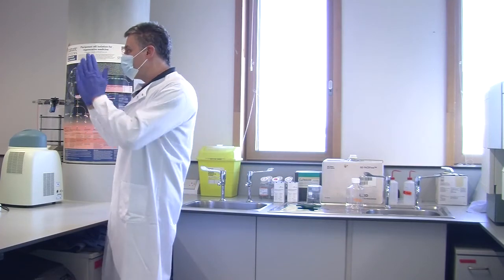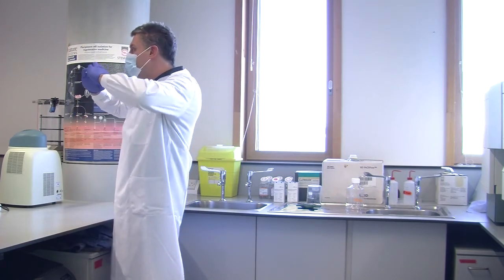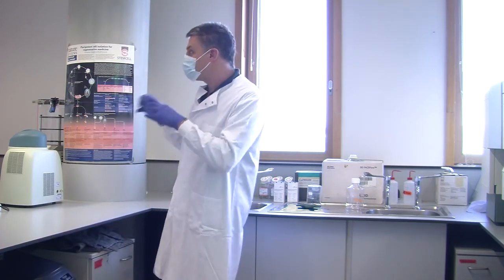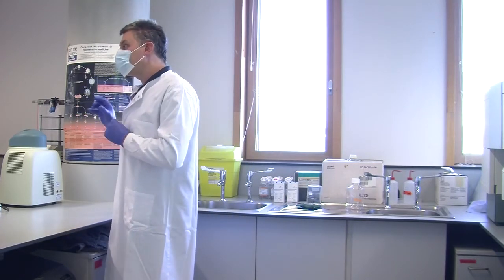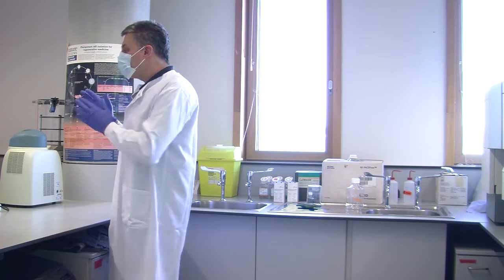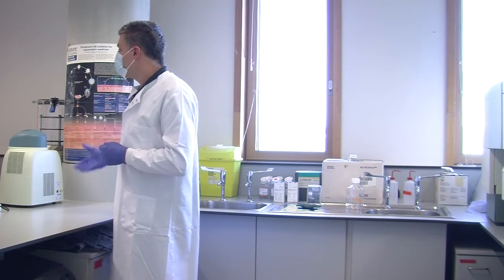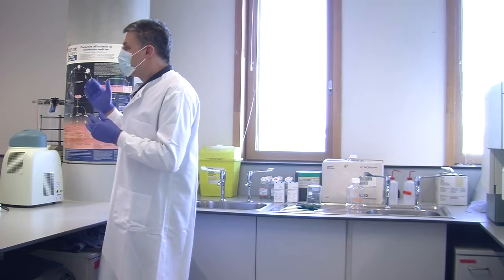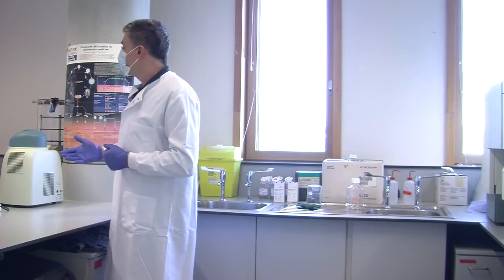But some fluorochromes have an emission spectra that's sort of that shape, which doesn't really affect others. Others have an emission spectra that's like that, which causes lots of other problems. So there's all sorts of different reasons to choose a particular fluorochrome. And when I say some are better than others, it's very subjective because it depends what you're actually looking at. A bright fluorochrome sounds good, but sometimes it's too bright, so sometimes you want a dim fluorochrome. A lot of times you need a bright fluorochrome. So bright is not necessarily good or bad, it's about what's appropriate.